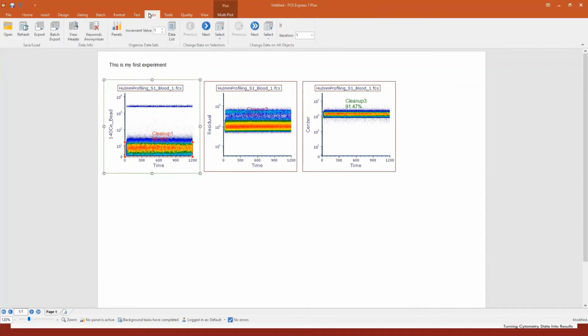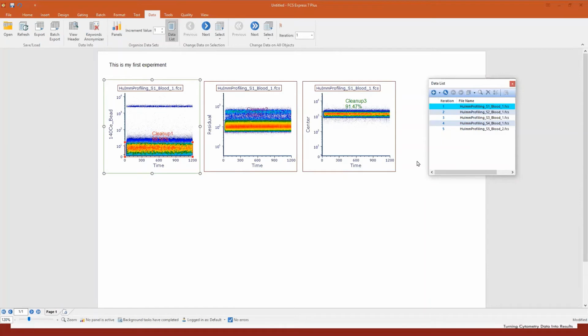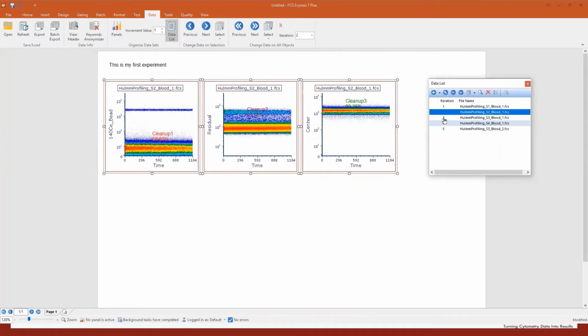Now, what you're creating with FCS Express, and this is really good to mention, is a template. A template is something that you can use to analyze multiple data. So you see here, I have multiple files of interest from this experiment. I have drawn my gating strategy, plots and title and whatever using file number 1, but I don't need to repeat this for every single file. I can go to file number 2 and see how it looks. I can go to file number 3, file number 4. So I can use my analysis as a template.